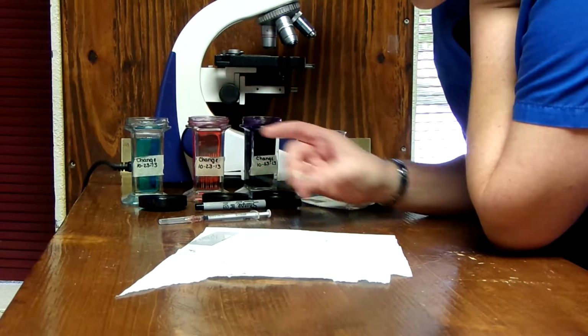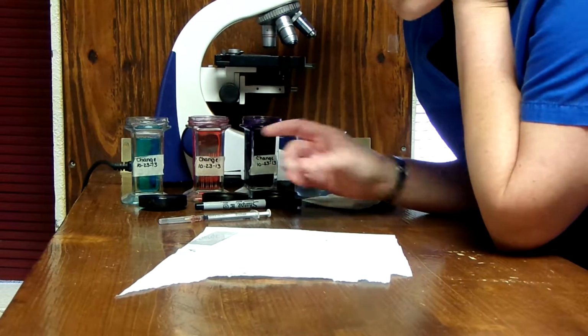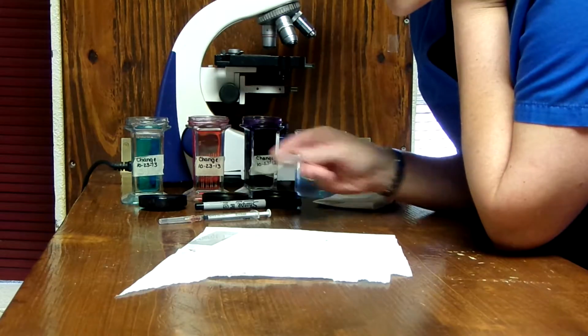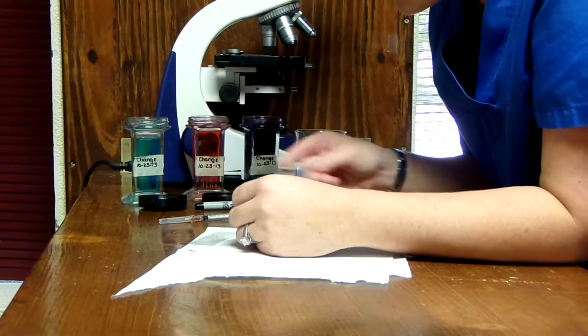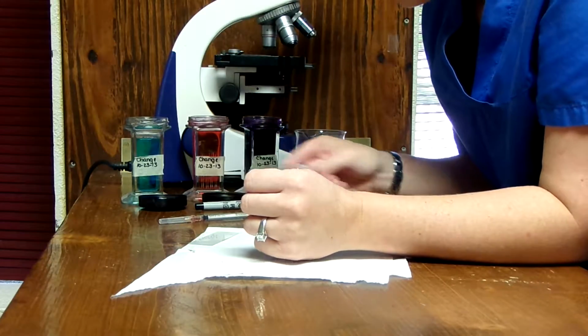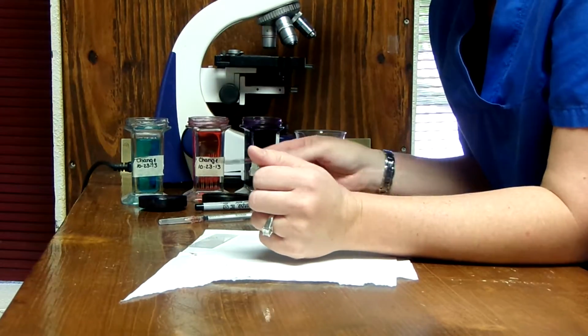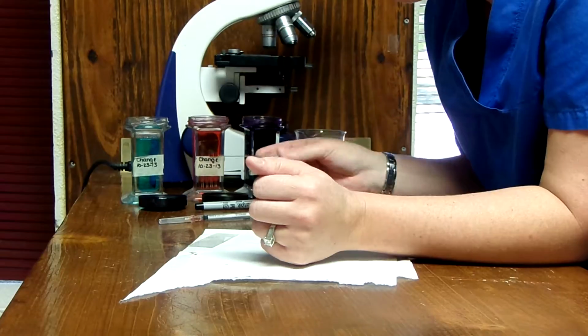Okay, so you kind of want to get it to go ahead and dry. You don't just want to leave it sitting, because whenever it's allowed to sit, of course, you're naturally going to have those red blood cells die, but they'll start to kind of crenate, they'll dehydrate and cause crenation, and you want to get it dry before that happens, so you can kind of get an idea of what they look like fresh.